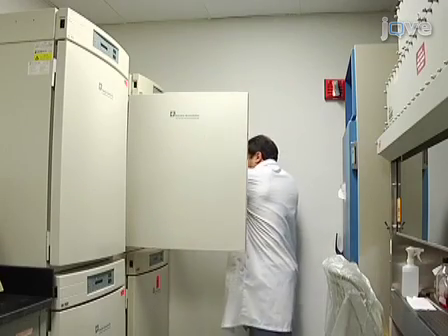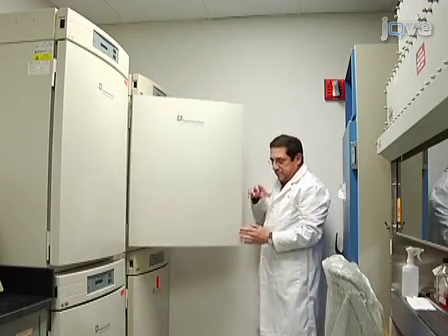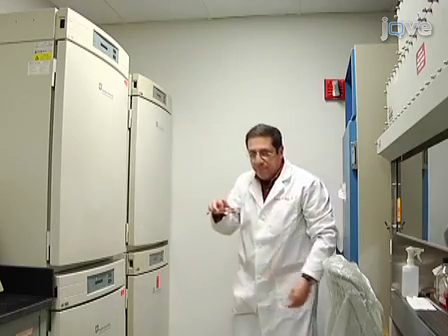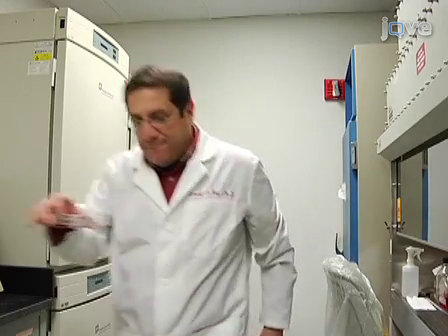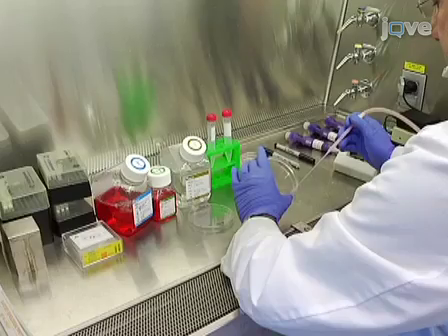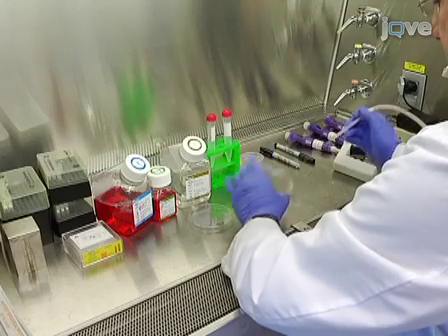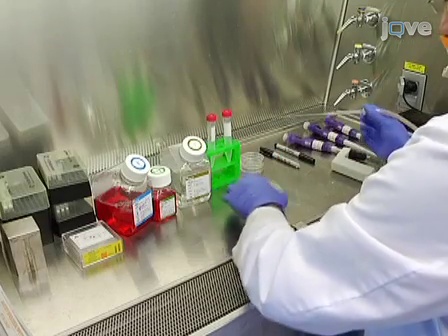To begin this experiment, harvest adherent cells at 90% confluency. First, aspirate the culture media and rinse the cell sheet twice with PBS.